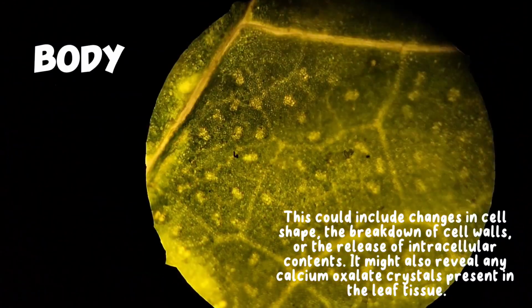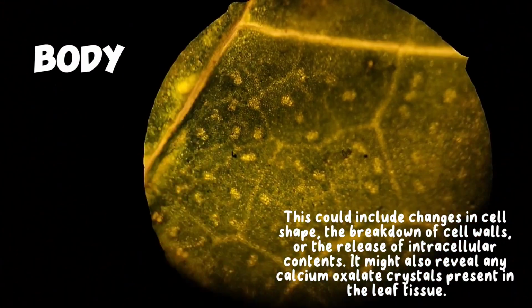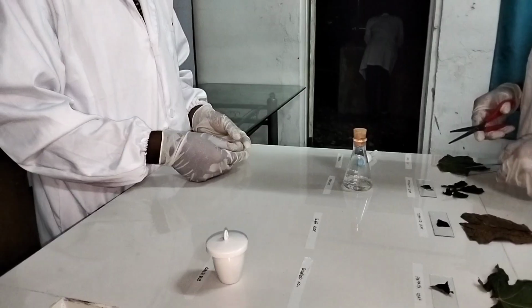These include changes in cell shape, the breakdown of cell walls, or the release of intracellular contents. It might also reveal any calcium oxalate crystals present in the leaf tissue.